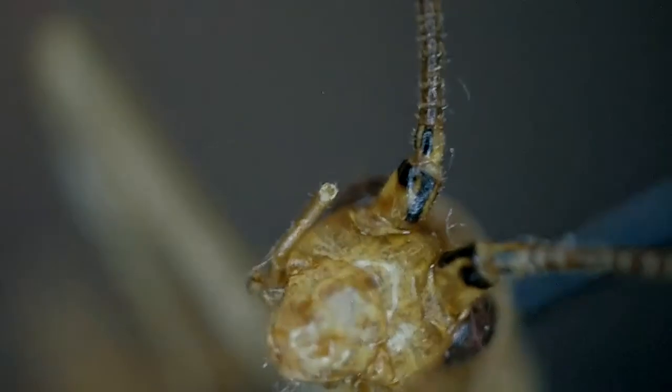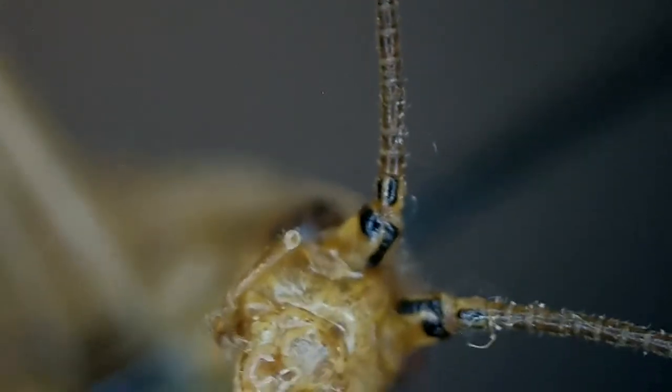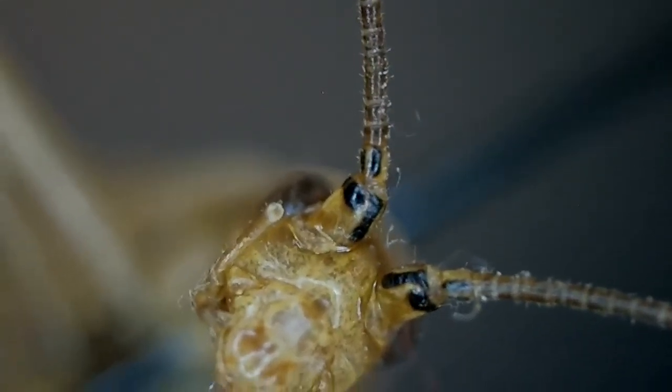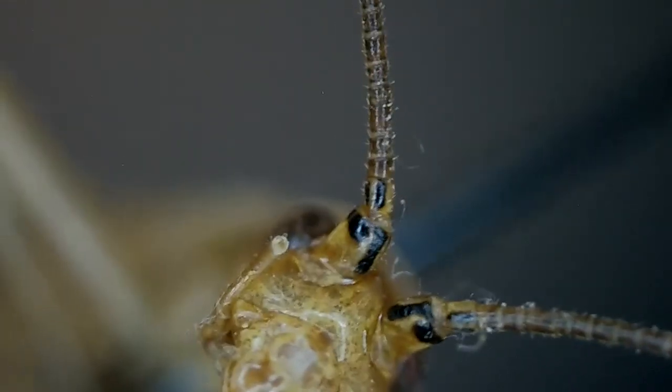Next is Forbesi. You can see the markings there — there's a little bit of glare coming from the light. The Argentinus specimen I showed you was collected in Texas, while this Forbesi specimen was from Wisconsin.